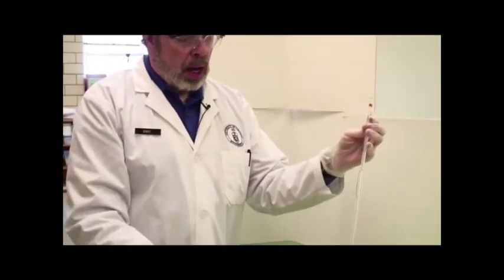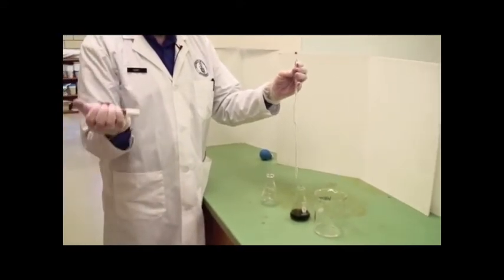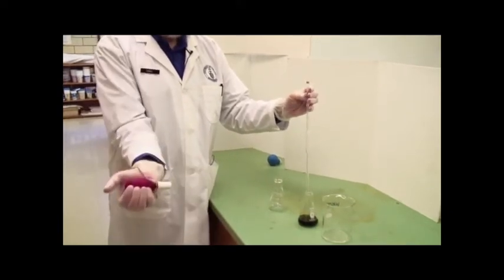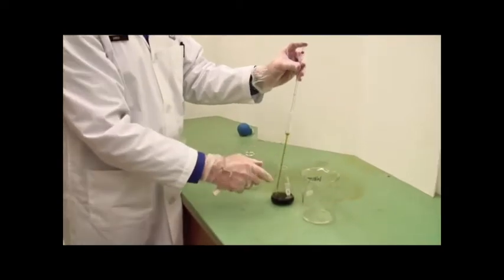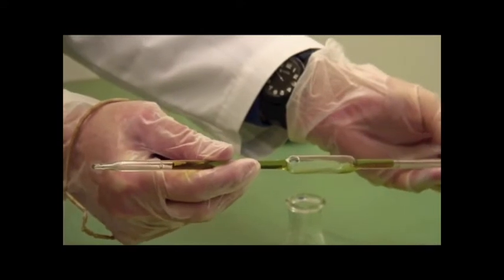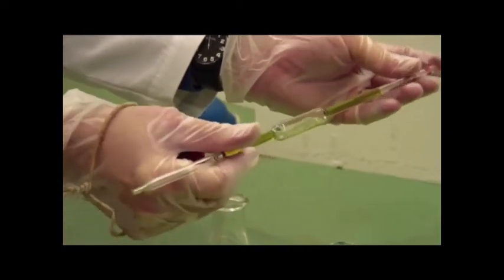I'm going to be dispensing this green liquid into this empty container, 10 mils of it. The first thing to do is to actually wash the pipette with whatever this liquid is, because who knows what's in there right now. Flatten the pipette bulb and apply suction to get some liquid inside. That's all you need to do. Now invert this, and by releasing the pressure on the top, I can let the liquid all the way up above the calibration mark, rotate the pipette so that everything gets wet with the liquid, and then dispense it.